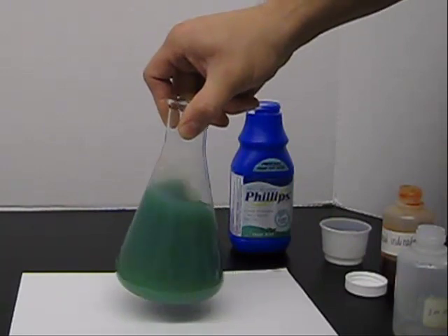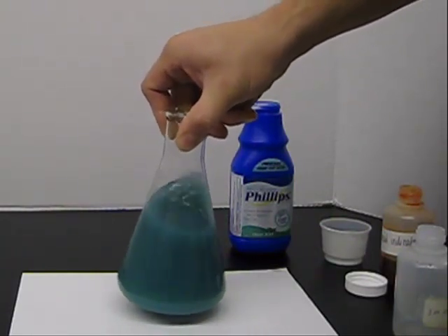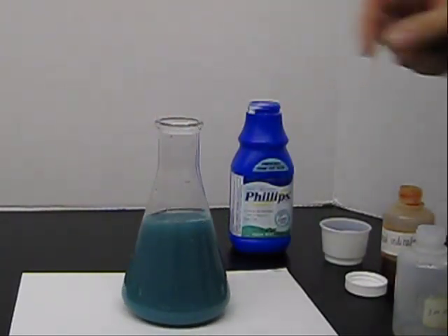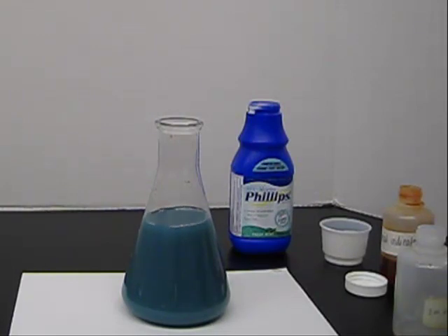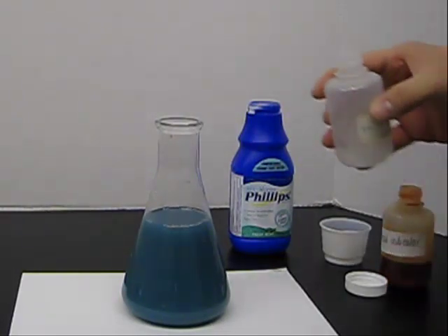And as that eats the hydroxide ions or reacts with the hydroxide ions dissolved in the solution, it becomes acidic for a moment. And then more milk of magnesia dissolves in.